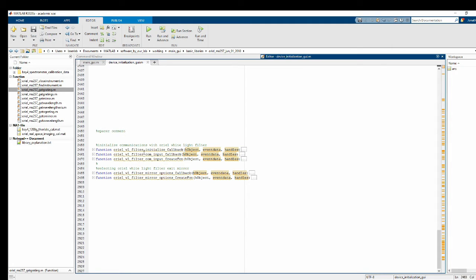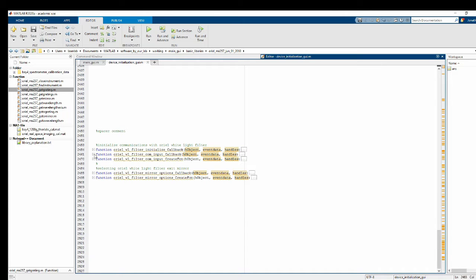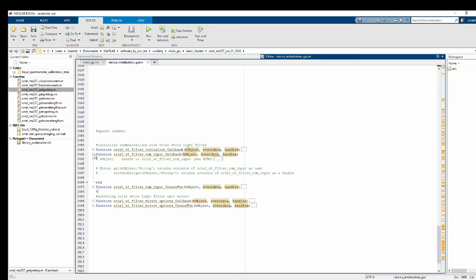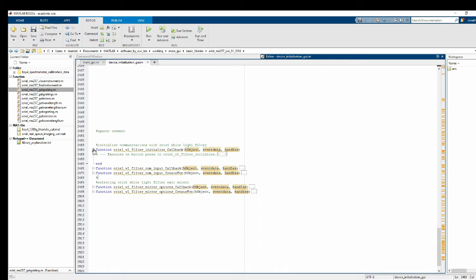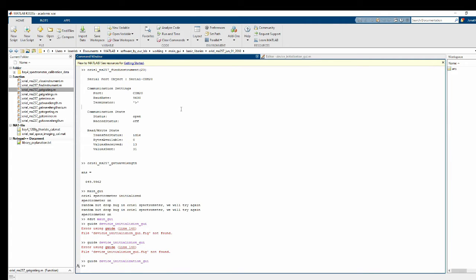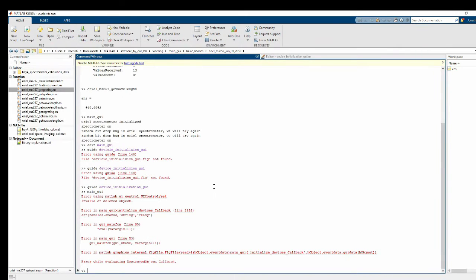Okay, so this button or this text input, we don't really need that to execute any code, so that's already done. And the creation functions we don't care about. This function though, this is what executes when we click that button. I'll show you which one. Now it might freak out a little bit. Okay, when I click this button, that's the one I'm about to edit now. Yeah, and it freaks out because all sorts of stuff going on that we haven't fixed yet.